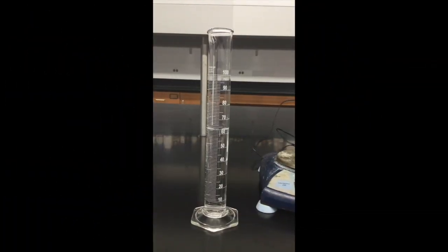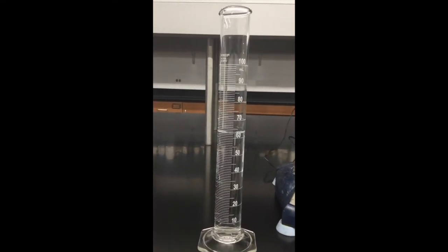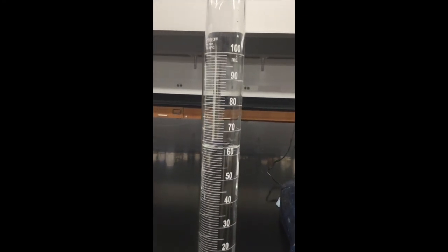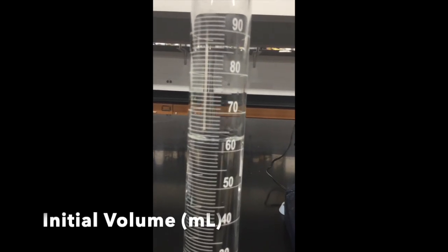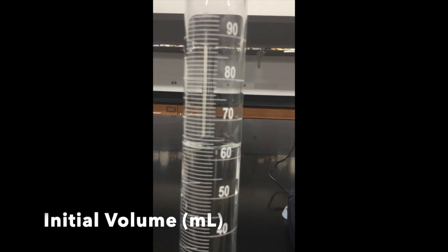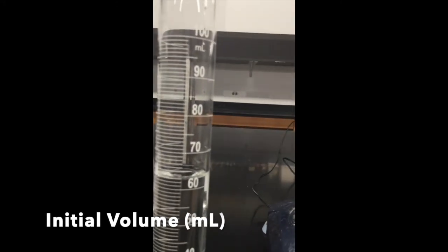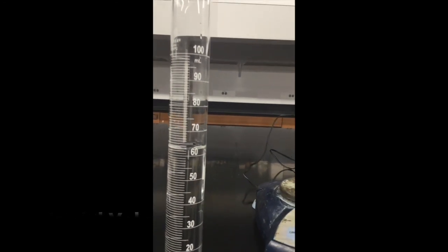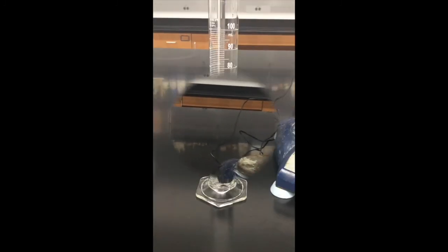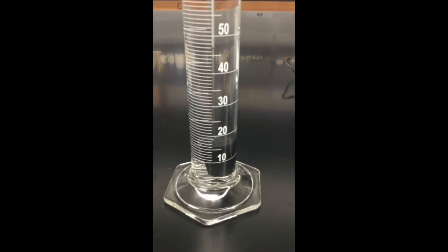You'll record the volume of water in the graduated cylinder for trial 1. Please make sure you record the volume to the exact decimal place. You need to read the meniscus. There is the initial volume. You have to see where the meniscus is. I think you can see from where you are. Record the initial volume before we place our rubber stopper on the balance. For trial 1, I have the rubber stopper at the bottom of the graduated cylinder in there.